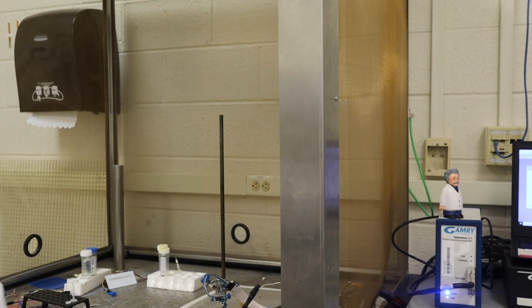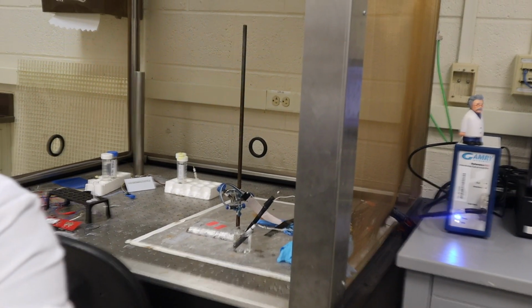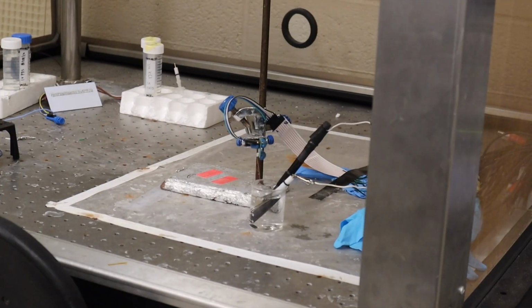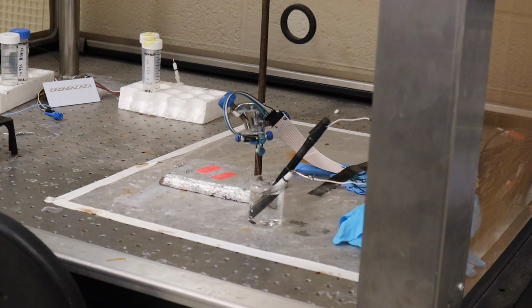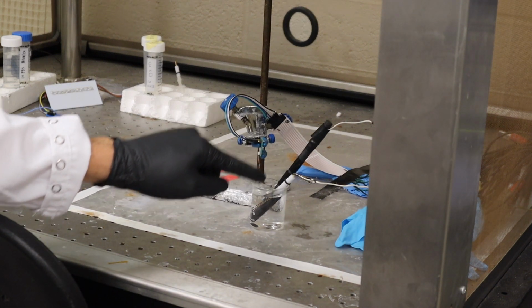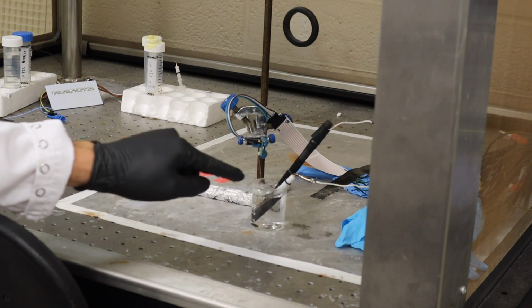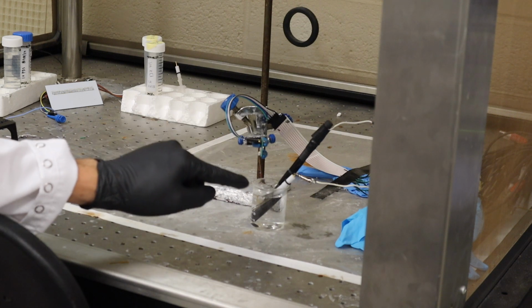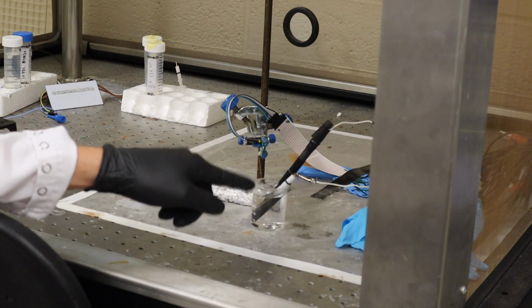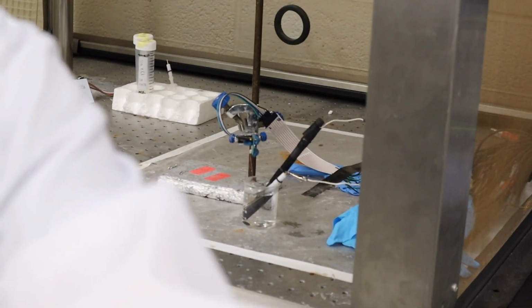And beyond that, we have our electrochemical setup right here. Let's see if I can zoom in on it a bit. So right here is our electrochemical setup. And you can see here we have our carbon rod. This long black rod is our carbon rod counter electrode. We have a small silver chloride reference electrode right here, and hanging from all these wires into the solution are our 6 working electrodes. And our working electrodes in this setup are 6 gold pins on a flex PCB cable.